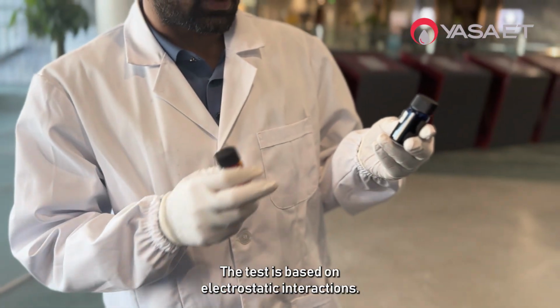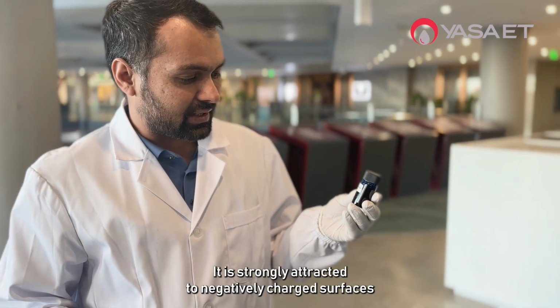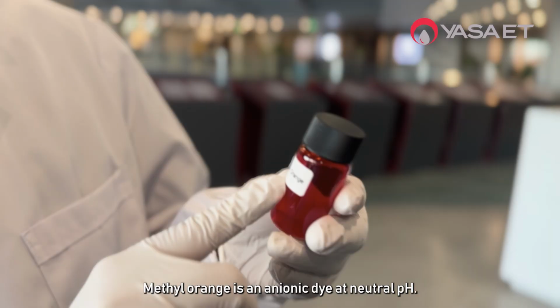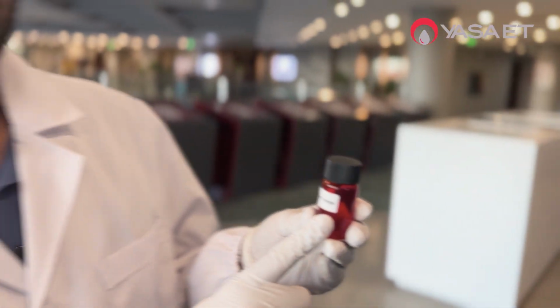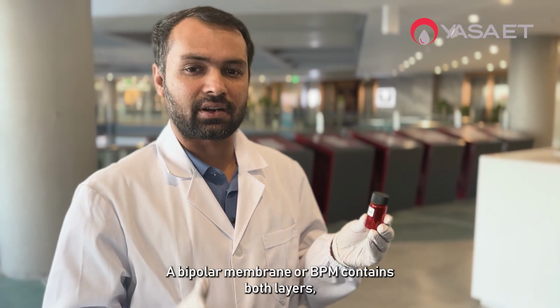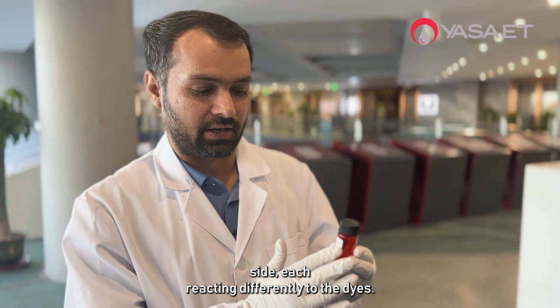The test is based on electrostatic interactions. Methylene blue is a cationic dye. It is strongly attracted to negatively charged surfaces such as cation exchange membranes, or CEM. Methyl orange is an anionic dye at neutral pH. It selectively binds to positively charged surfaces such as anion exchange membranes, or AEM. A bipolar membrane, or BPM, contains both layers, one CEM side and one AEM side, each reacting differently to the dyes.